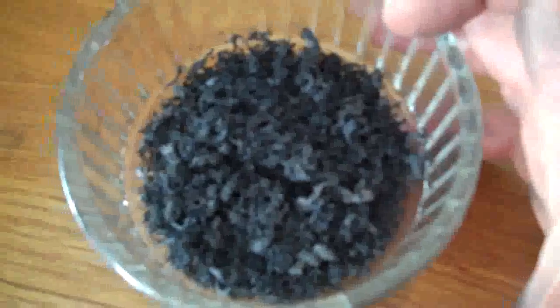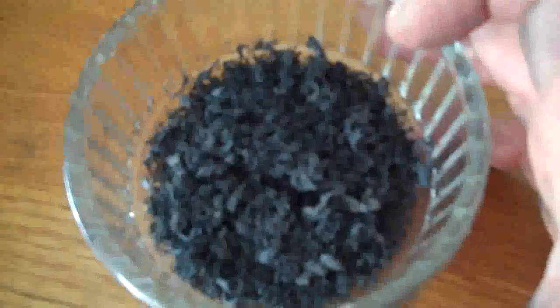Okay, so we pick that back out. Now, look at the volume increase on that. Isn't that phenomenal? That quarter of a teaspoon has increased in volume. I don't know how far, to be honest. I'd have to measure it. So what we're getting there is an excellent exfoliated graphite. So that graphite that I began with has exfoliated tremendously and led to this here. Now, this is a strange substance. It actually feels quite spongy when you touch it, and it forms a mat really, really easily. So as you press it, you can form a mat.